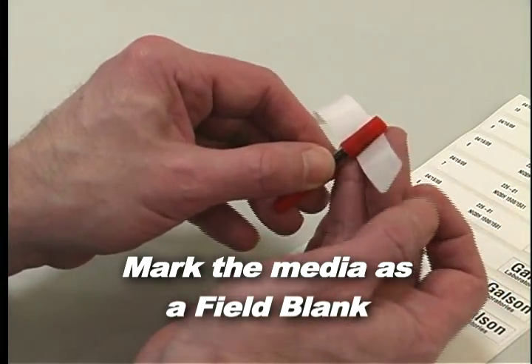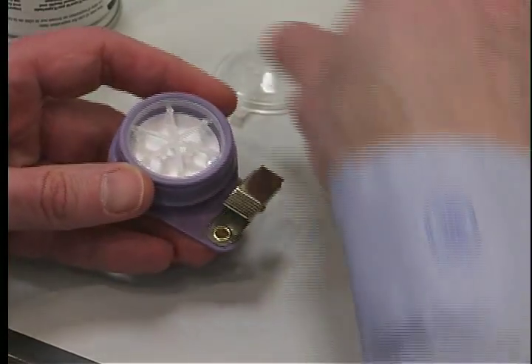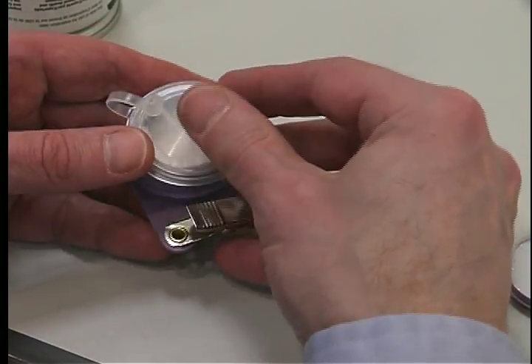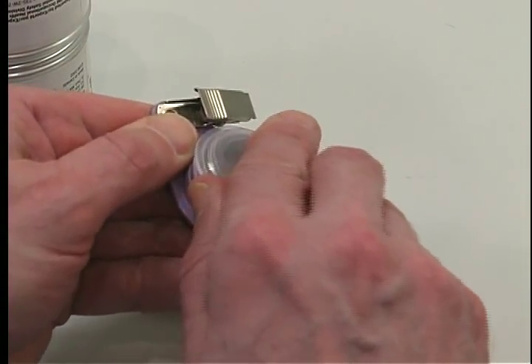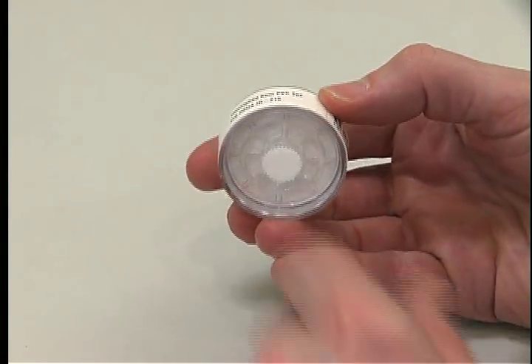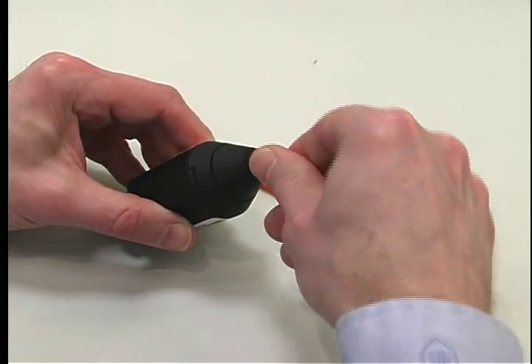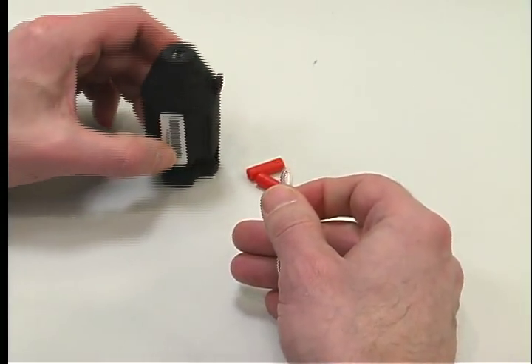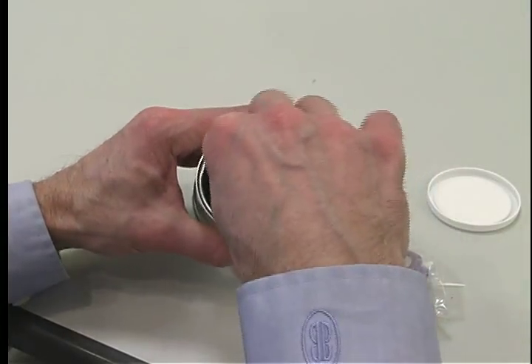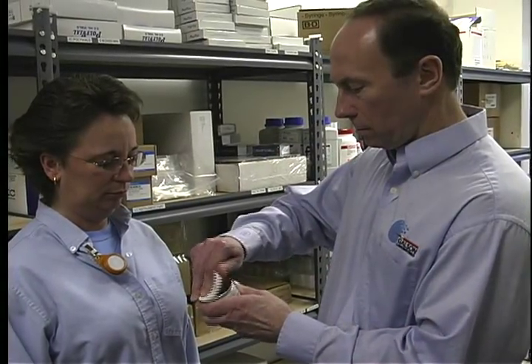First, make sure you mark the media as a field blank. You can do this right on the media label, or mark the media with your standard label number and identify it on the chain of custody form as a field blank. Open the field blank media just as you would the sample media. If it is a cassette, remove the plugs or nibs, or open the cassette just like the sample media. If it is a sorbent tube, score it and break it open on each end, using the same tool you use for the sample media. If it is a badge, open the container and remove it. If there is any contamination in the air, on the tool, or on your hands, it should equally affect both pieces of media.